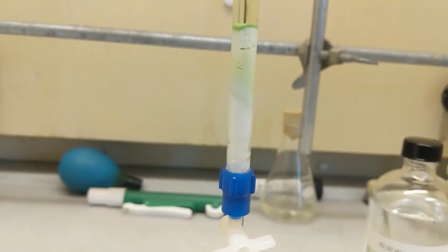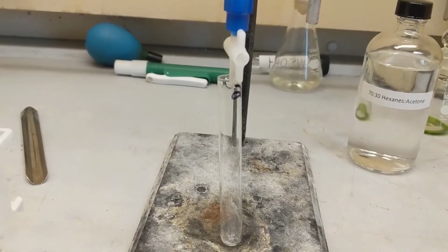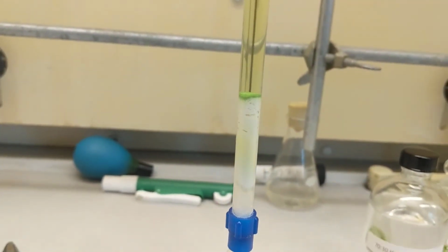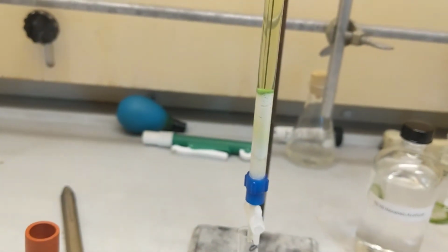I don't know. We'll see. Wish me luck. As you guys can see, I switched to test tube number 2, and I'm going to pull out this first band I have. I think I put too much solvent, but it said I had 4 milliliters. Anyway, I'm going to pull out that first band. Catch you guys after.